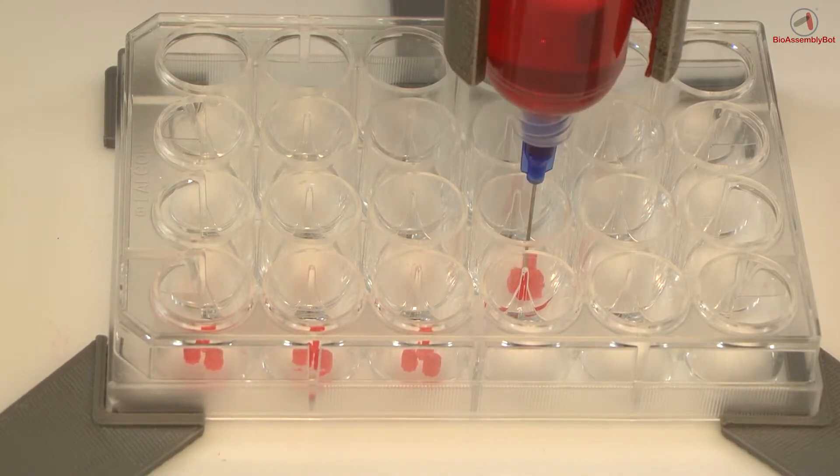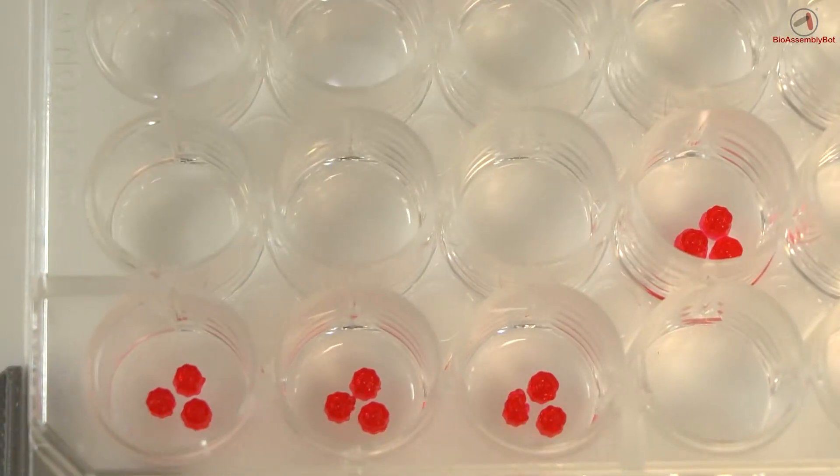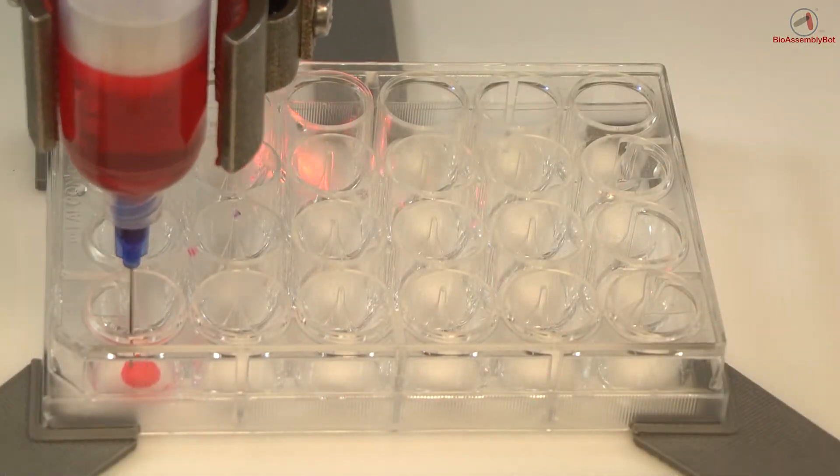This creates a 3D tissue assay system. In the other example coming up, we'll be printing two different tissue compartments.